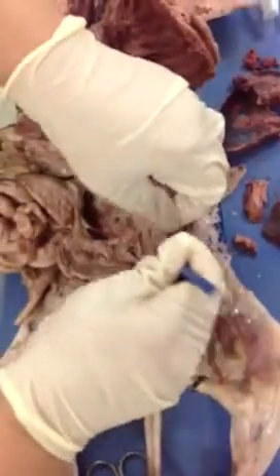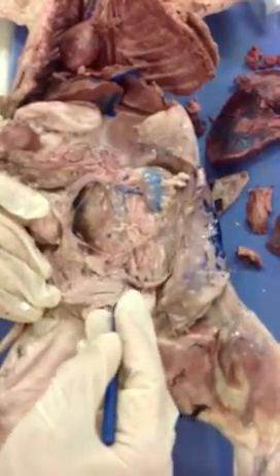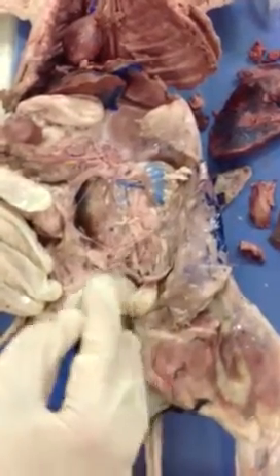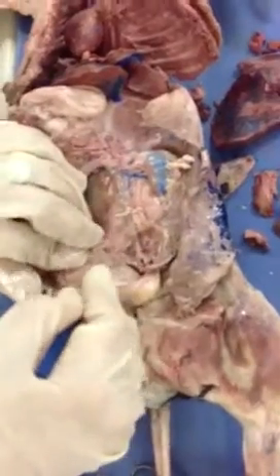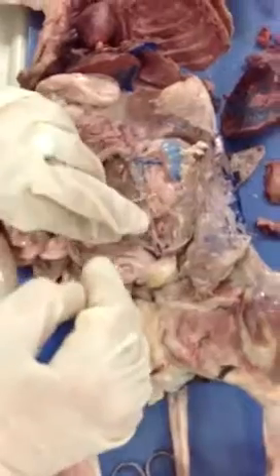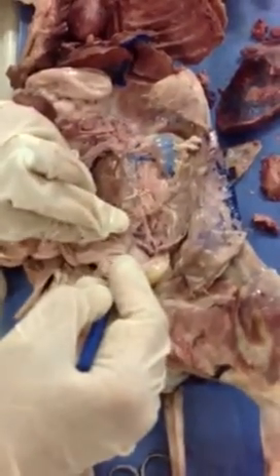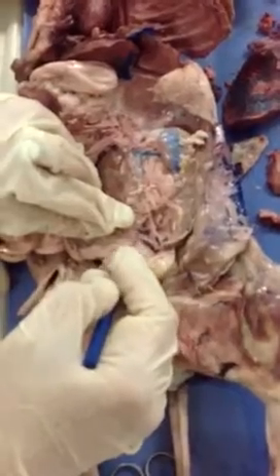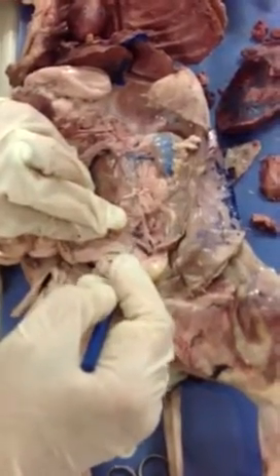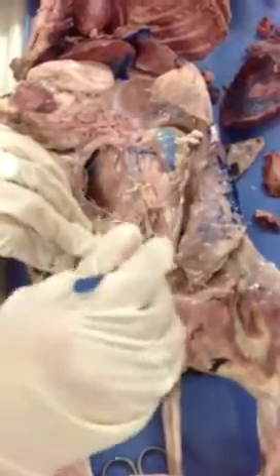These are my iliolumbar. So this is going to be my left iliolumbar, and this is going to be my right iliolumbar. What do they provide blood supply to, please? Body wall muscles. So you also notice that here we have the artery and the satellite vein. You see it? Iliolumbar artery, iliolumbar vein. You see it? Now, let's go on, please.